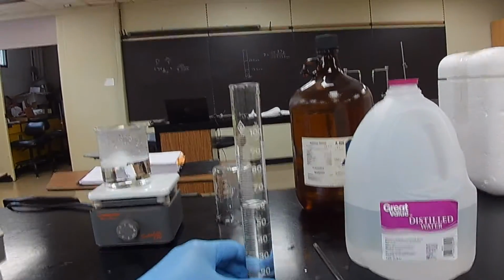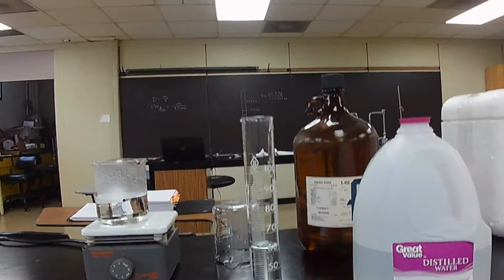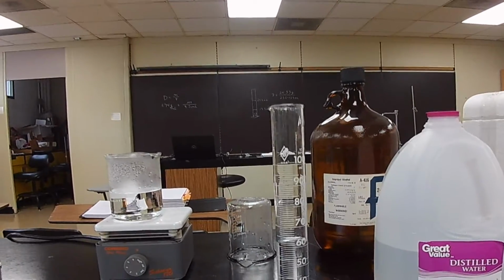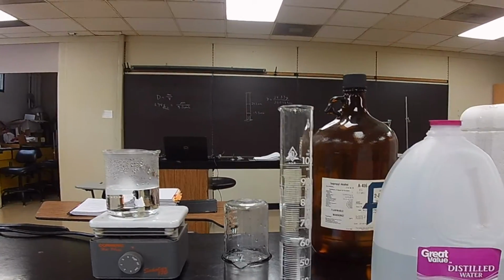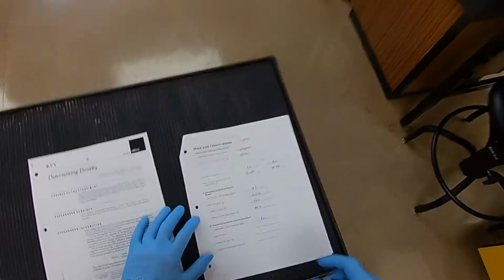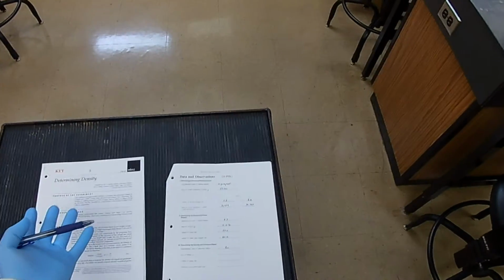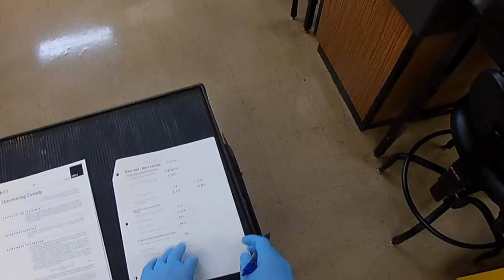And as you may have guessed, the volume is higher. Okay, let's see. Eye level. So I've got 60, but not quite 61. 60 point, looks like about 7. 60.7 milliliters. All right, so just estimating, I would say 8.7 milliliters of volume, and the mass divided by the volume will give you the density. And we'll do those calculations on a different page.